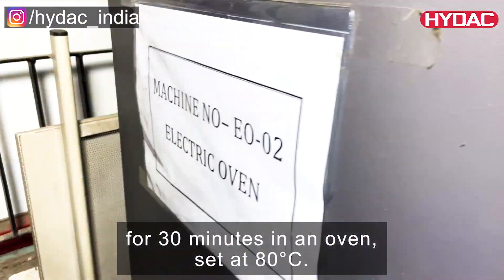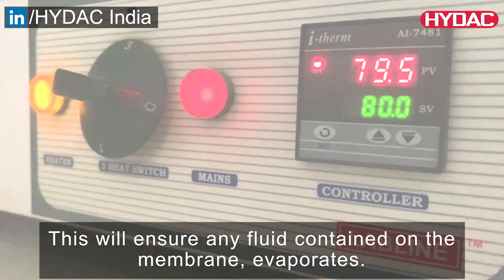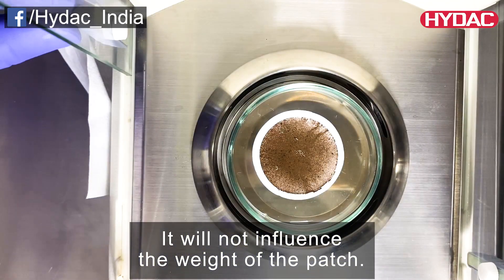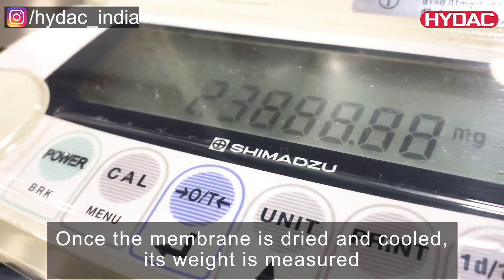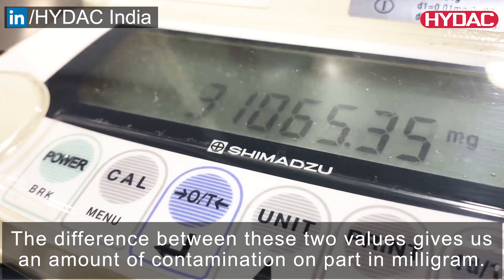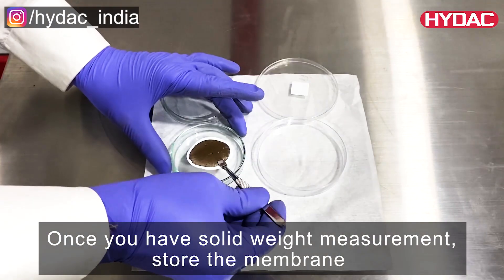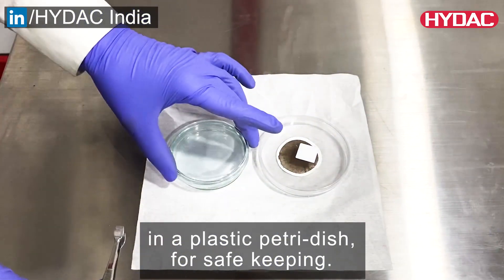To ensure 100% accuracy in the contamination reading, the membrane will need to be dried for 30 minutes in an oven set at 80 degrees Celsius. This will ensure any fluid contained on the membrane evaporates and will not influence the weight of the patch. Once the membrane is dried and cooled, its weight is measured and compared with the weight of the clean membrane. The difference between these two values gives us an amount of contamination on the part in milligrams. Once you have solid weight measurements, store the membrane in a plastic Petri dish for safekeeping.